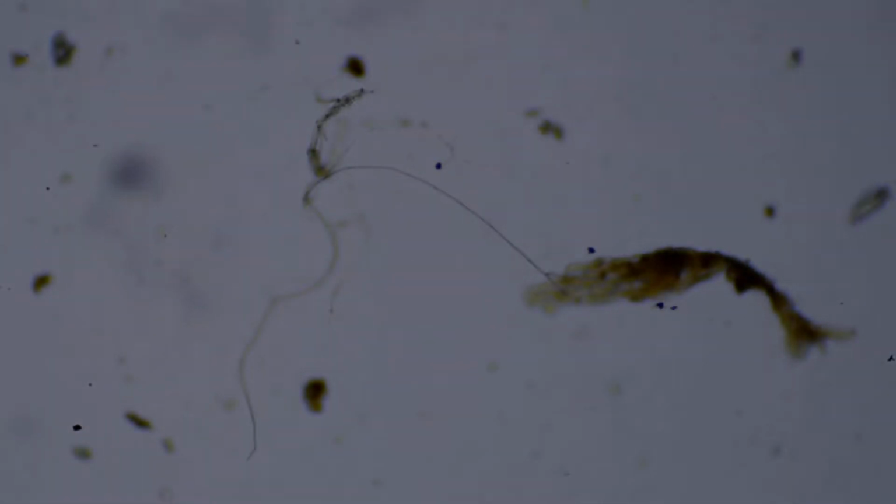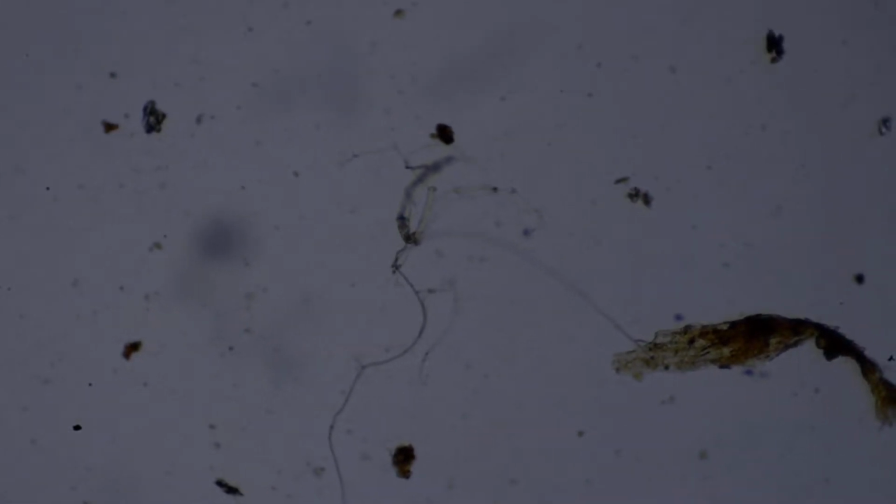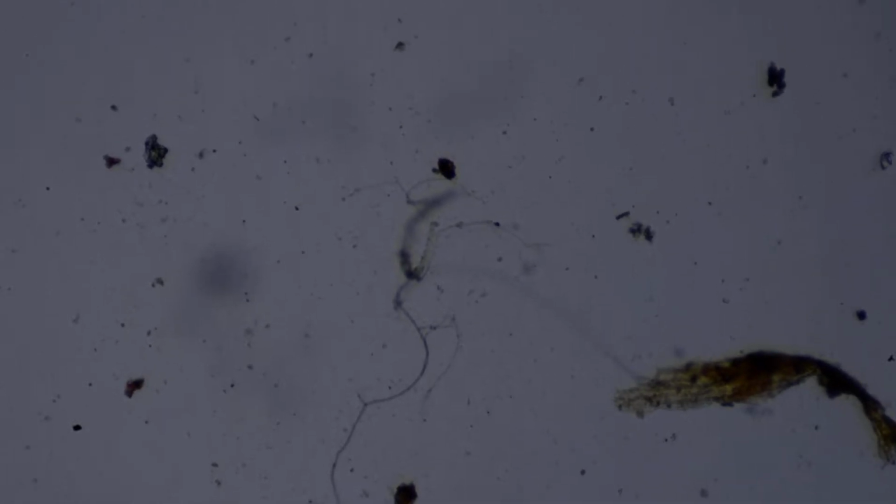The focus on my microscope and the camera that I'm filming it on are not on exactly the same plane, so some of it might look out of focus to you, but I try to get a bit of a compromise. This is times 100. This is a mycelial strand that you can see right in front of you, the thing that looks a bit like a root. All these tiny little dots are a mixture of minerals, sand, salts and clays, and a large amount of bacteria. Once we zoom into 400 times, you'll see all the bacteria moving around.